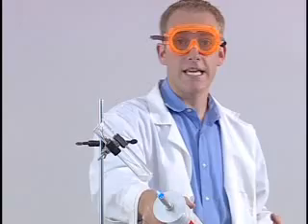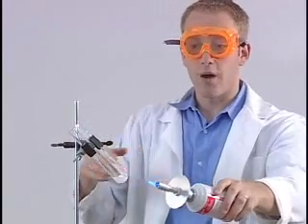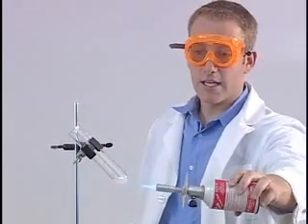And the reason I'm heating it on all different directions right now is because I want to make sure that I evenly heat the liquid so that it's not one part getting heated more than another, and the test tube shouldn't be that hot either, or else we can get some really dangerous problems in this lab.